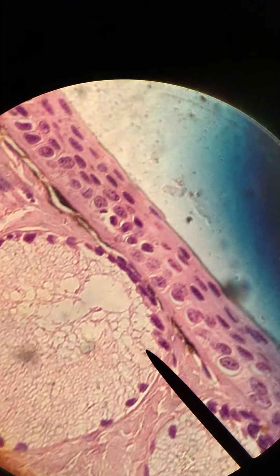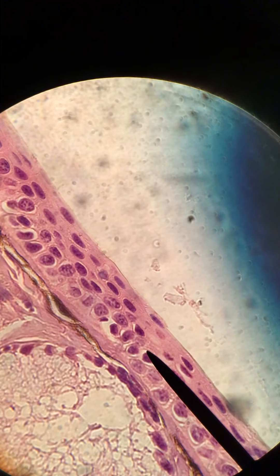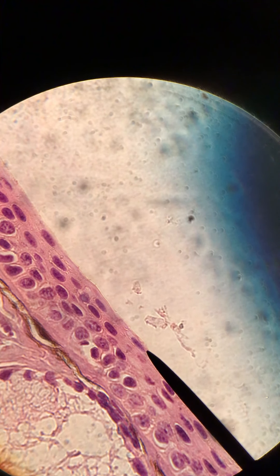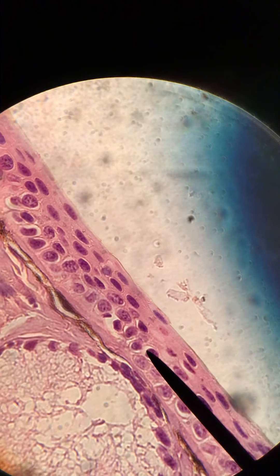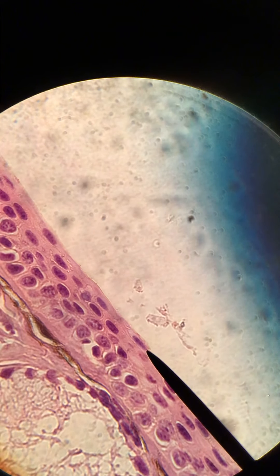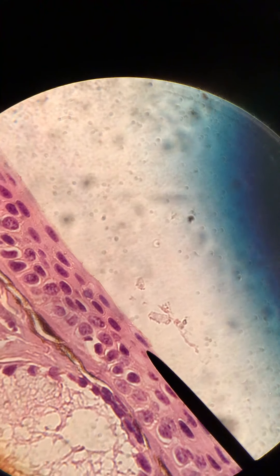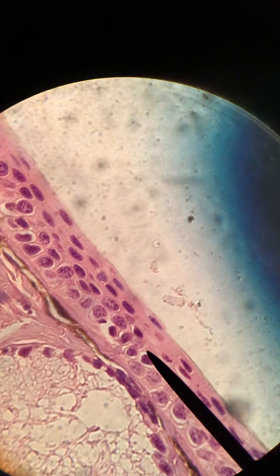Okay, and we're going to go back up and look at our stratified squamous epithelium. Here you can see that the topmost — the apical layer of that stratified epithelium — the topmost layer is made up of squamous epithelial cells. So that's all stratified squamous epithelium.